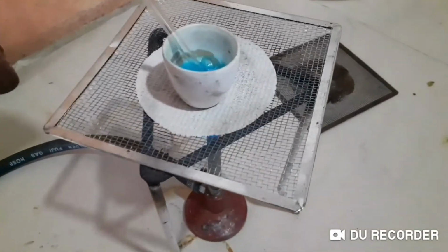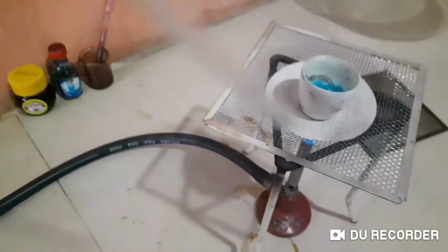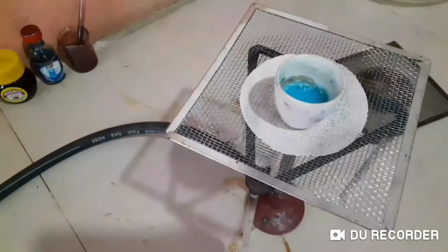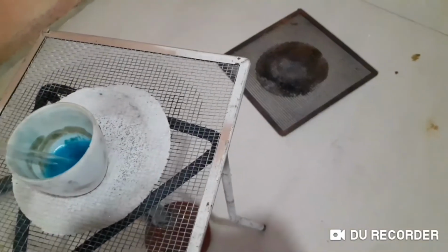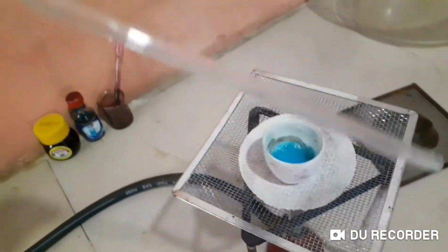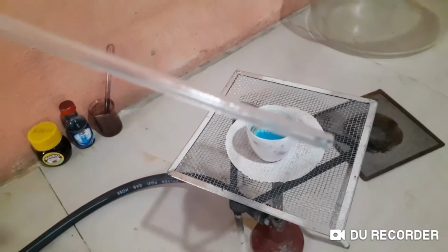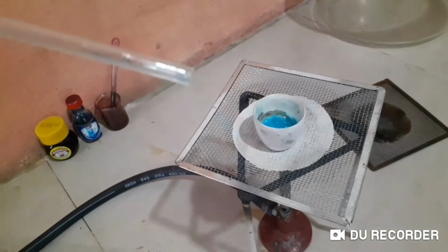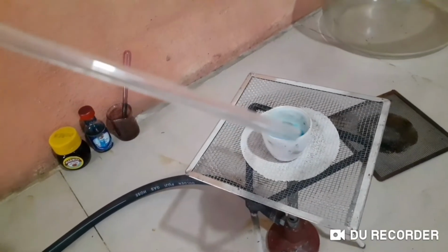It's not thick actually, but you can see the color nicely. That's copper sulphate, right? How do we know if it's thicker? You can take the glass rod out and see whether there are small crystals forming on the glass rod. Can you see any crystals on the glass rod?